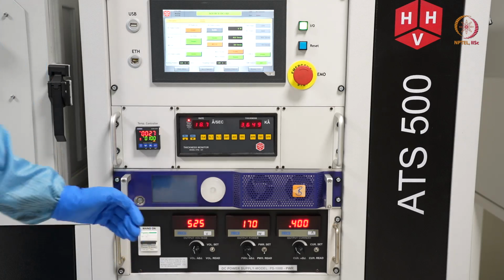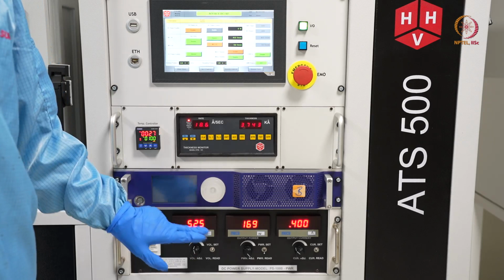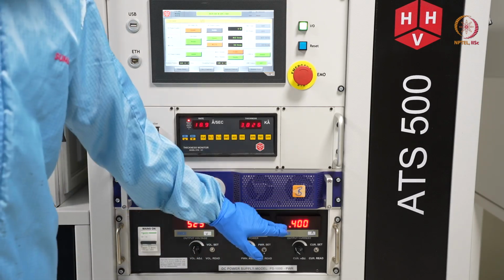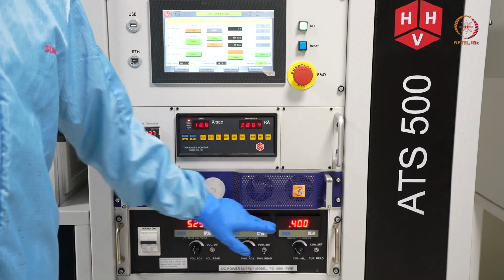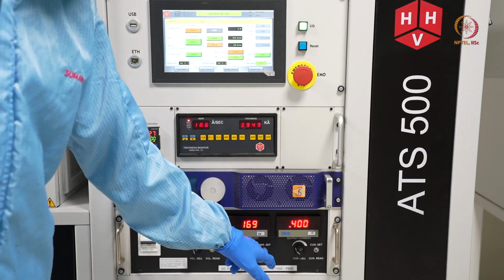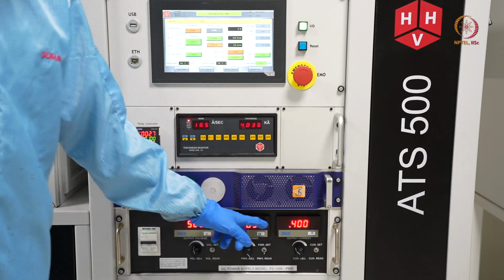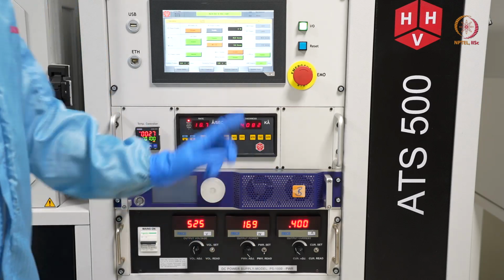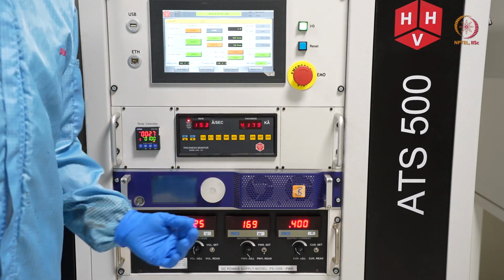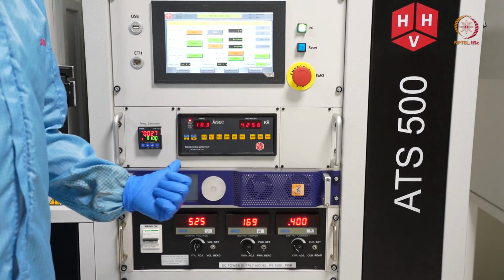So here, as we mentioned, I changed this to 525 now. When we first focused inside, it was 400, now it is 525. Second, this has also increased, so the effective power, the power delivered, we put it to power read. So this is the actual power delivered. This also increased to 170, and that is why that was the plasma color and that much glow intensity that you saw there.